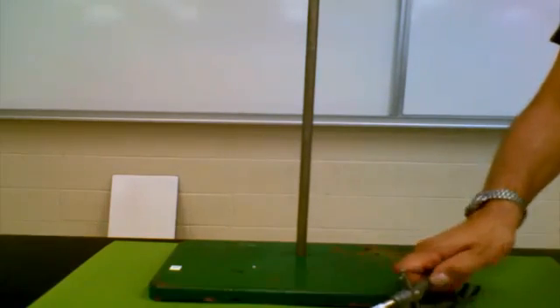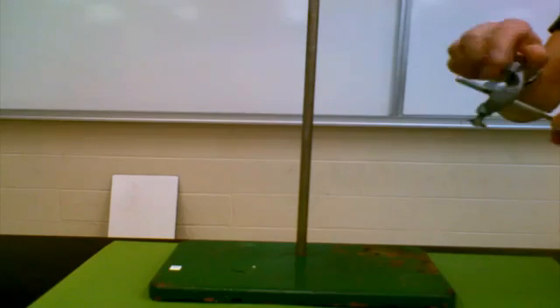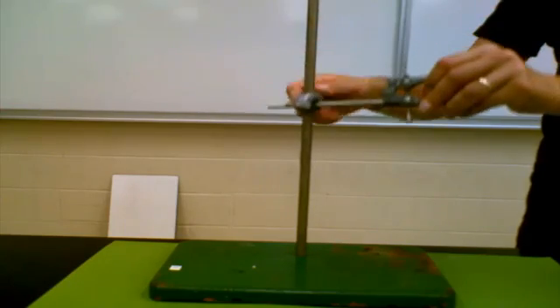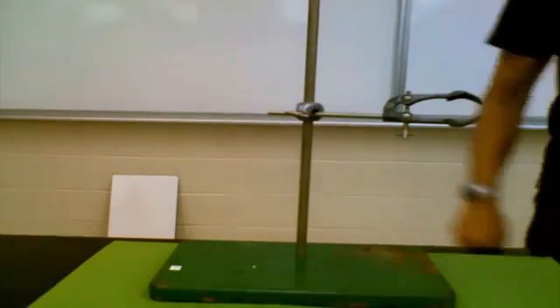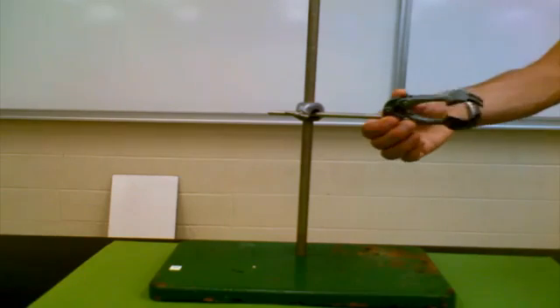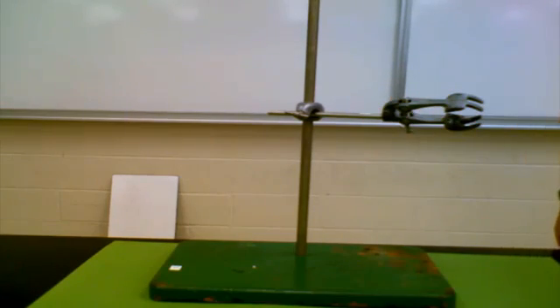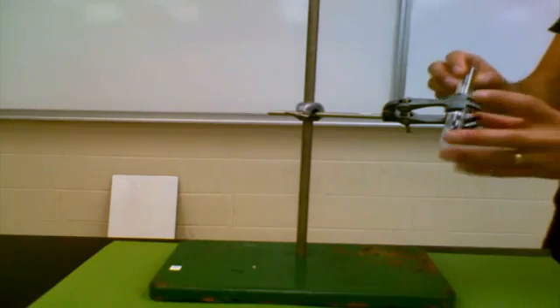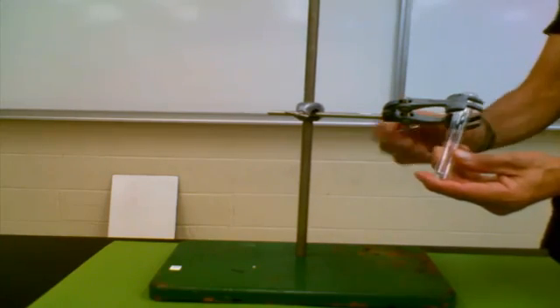First thing you should do is place your clamp on the retort stand, like so. The next thing you need to do is take your test tube, place it into the clamp, and tighten the clamp.